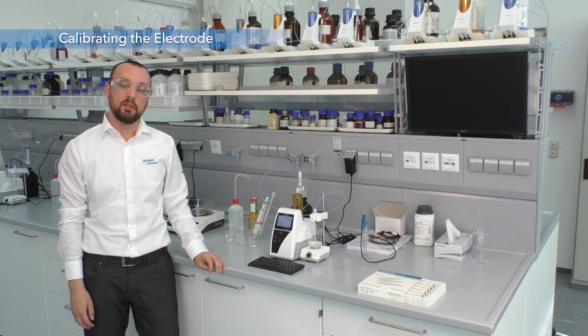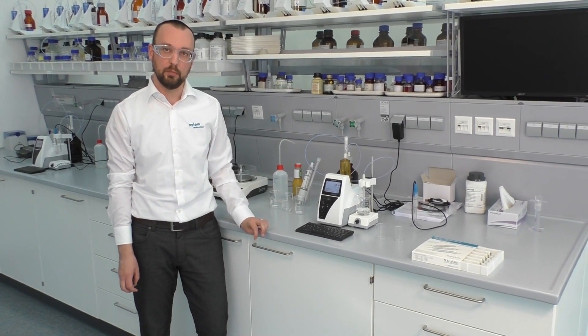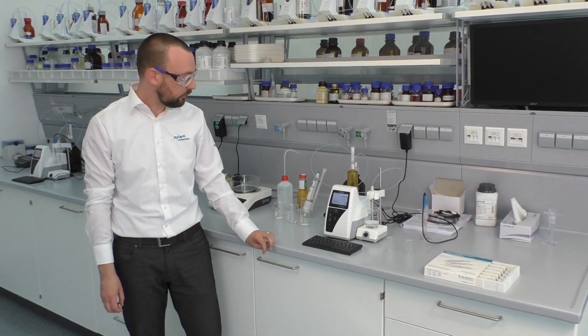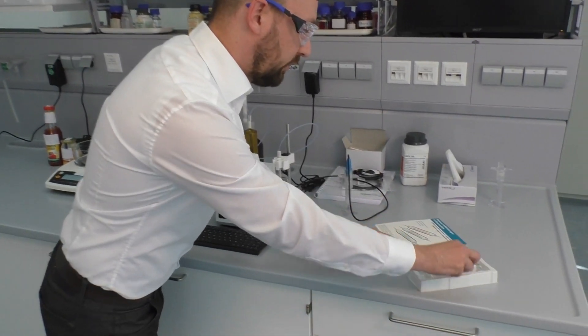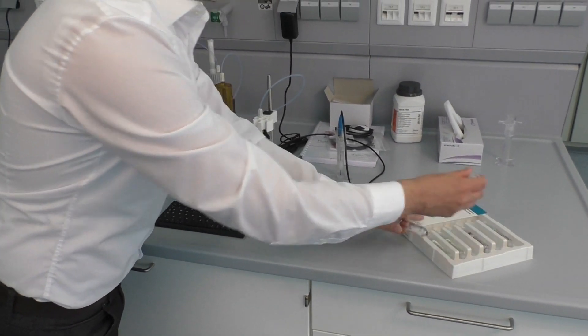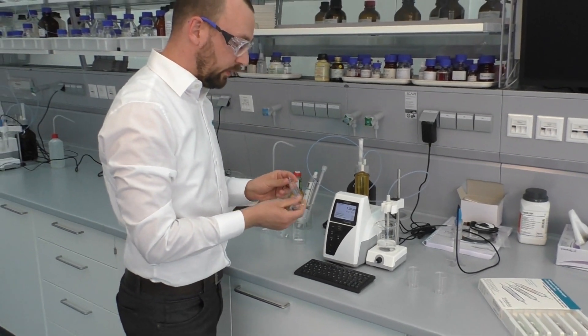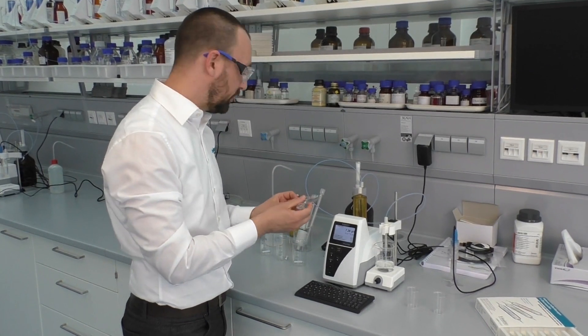As the determination of the total acidity in juices is an endpoint titration, we need the exact pH of the sample. Therefore we need to make a calibration of the pH electrode. To make the calibration we need buffer solutions. We will perform a two-point calibration, using pH 4 and pH 7 as calibration solutions.